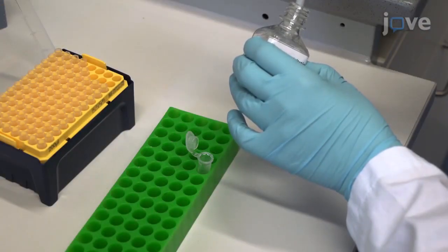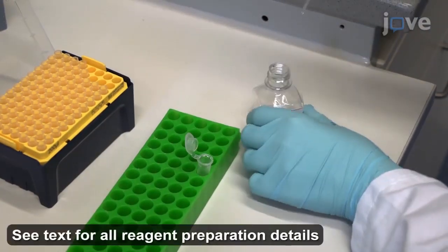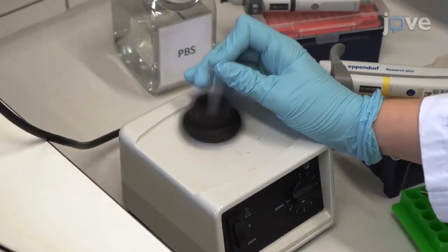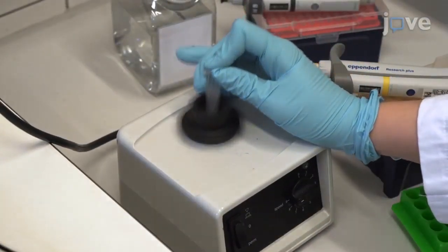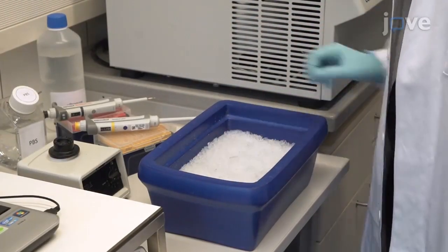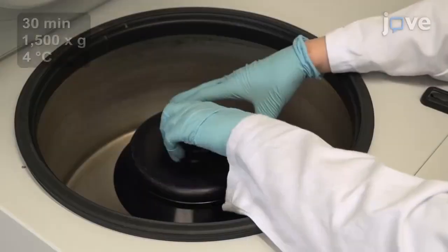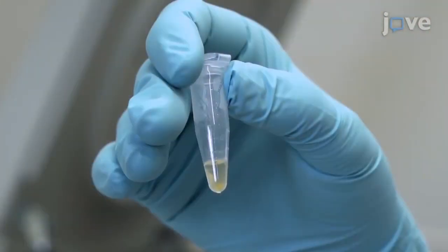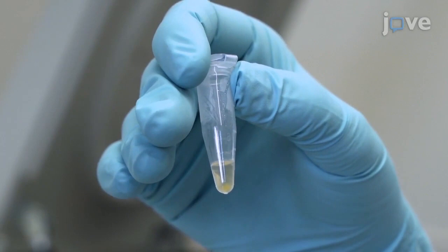Next, add 25 microliters of exosome precipitation solution to the plasma and vortex the samples thoroughly. After a 30-minute incubation on ice, collect the extracellular vesicles by centrifugation. The pellet will appear as a beige or white color.